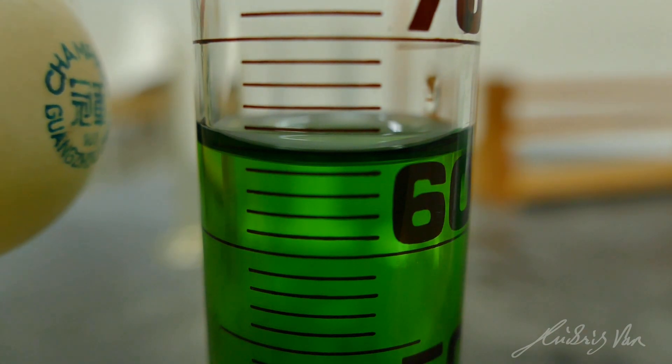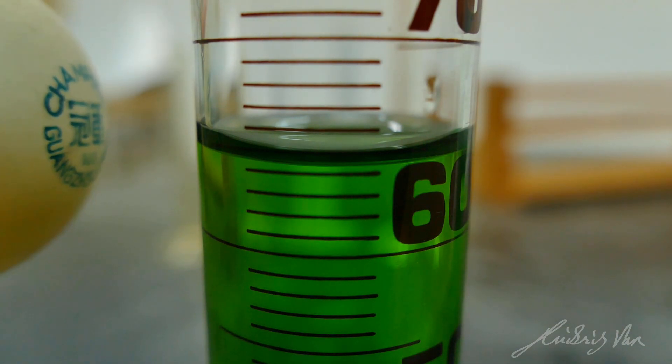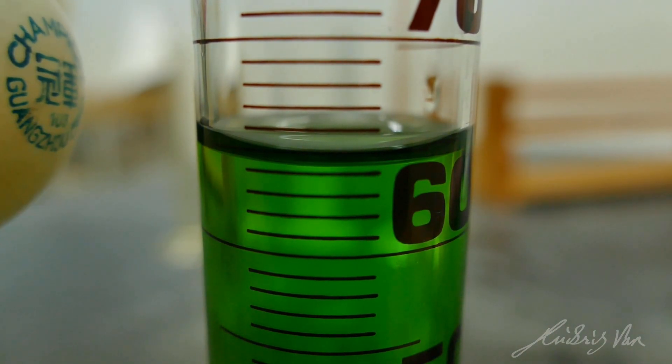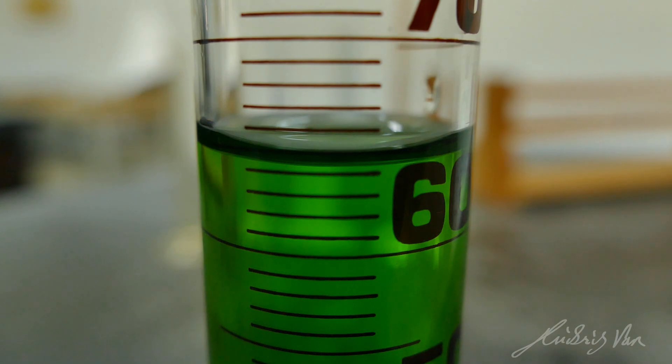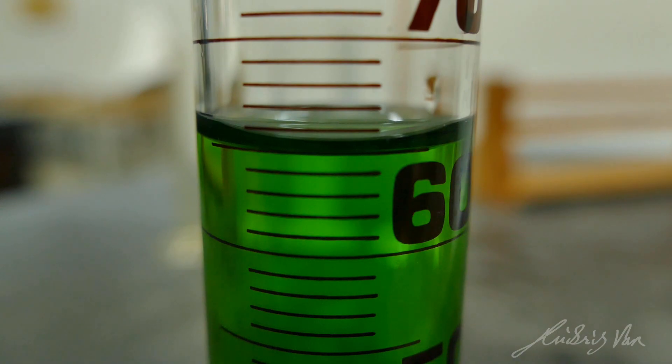But of course, you do not have to go in so near to the measuring cylinder. You can look at it from a further distance away. So we are about there at the 65 ml mark. I just need to add a bit to ensure that the meniscus is at the 65 ml mark. You can see the meniscus, or the bottom of the liquid, is now at the 65 ml mark.